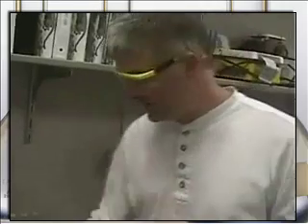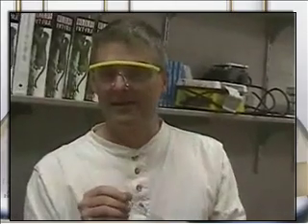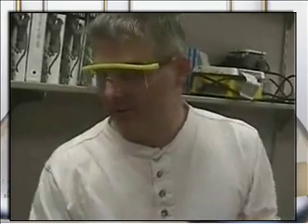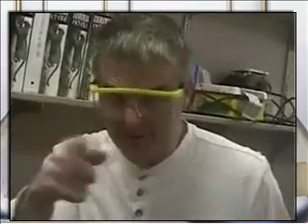Actually, one thing I did not say. Is this a good idea, Mr. Sams? To suck with my mouth? No! Why not? Because you don't know where it's been. That's right. And because, you know, actually, if it was like nickel 2 nitrate, it would cause brain damage. You might think I already have brain damage, and you might be true. But hey, that's your own problem, because I know I'm a good man.